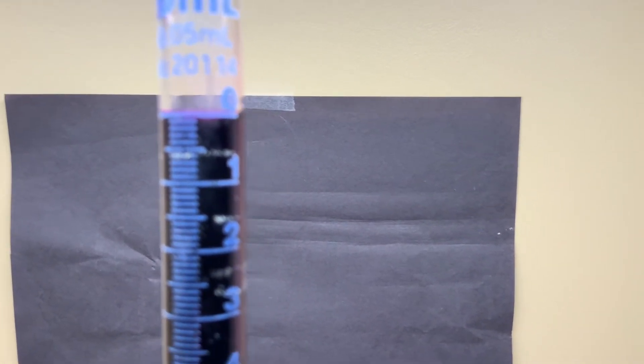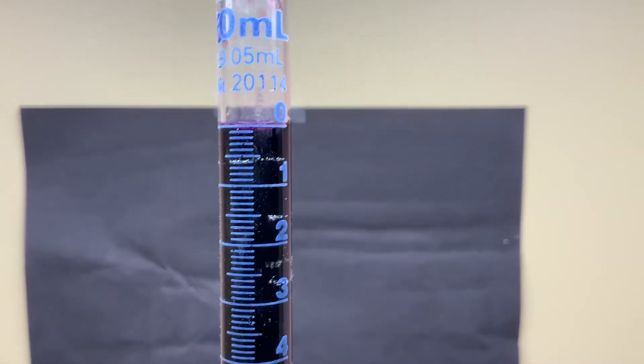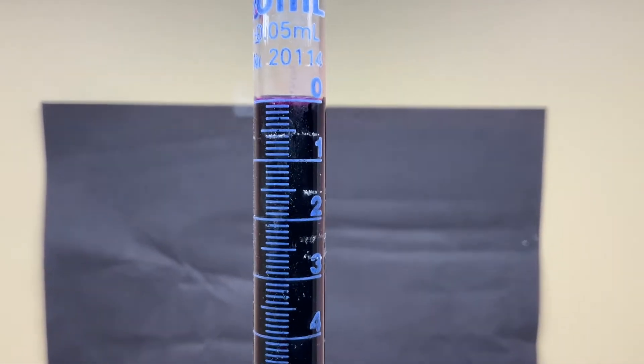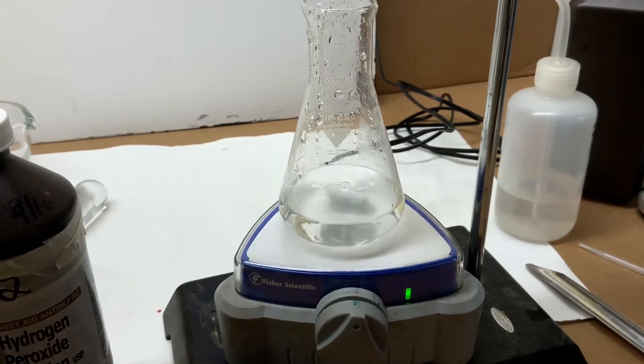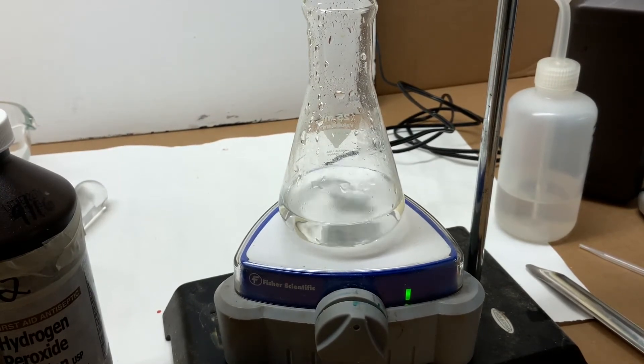The burette's filled to zero. Record that as your initial burette reading. And acid, sulfuric acid, will be added.